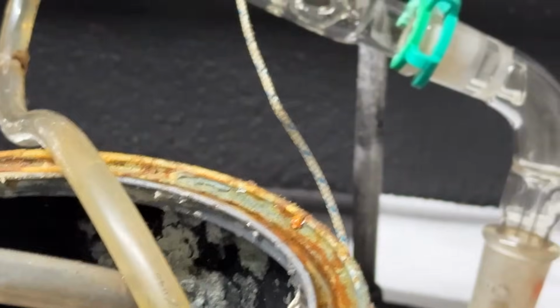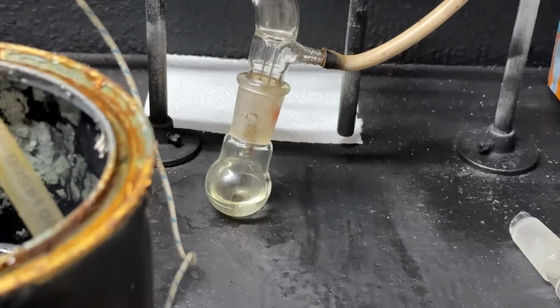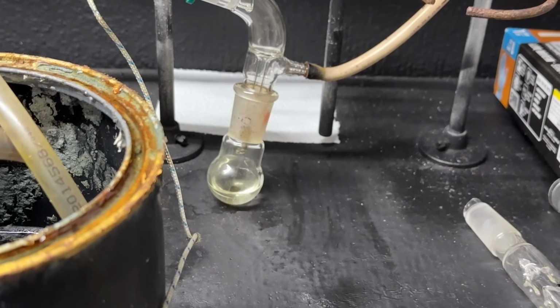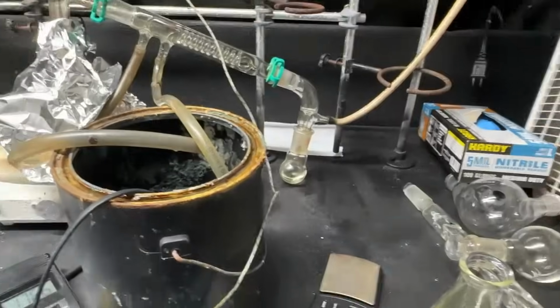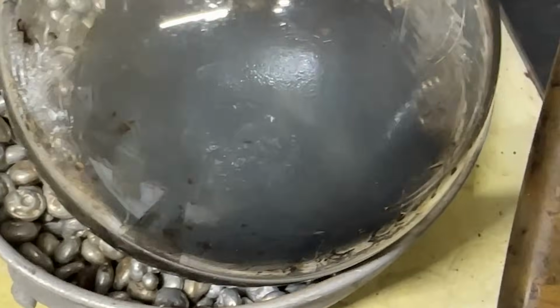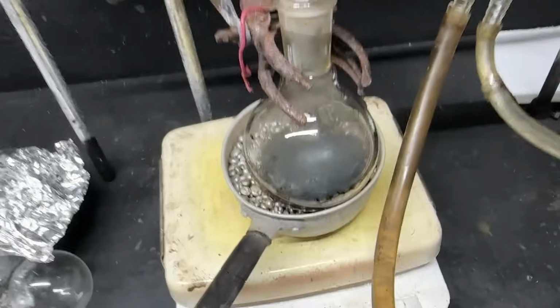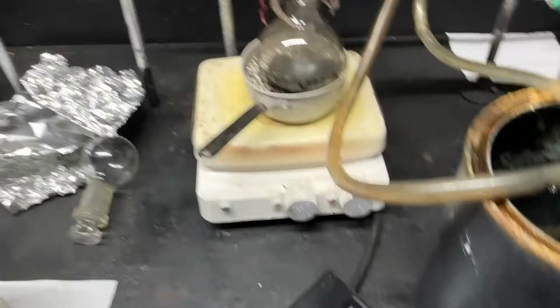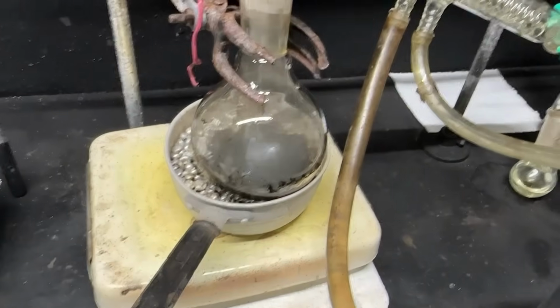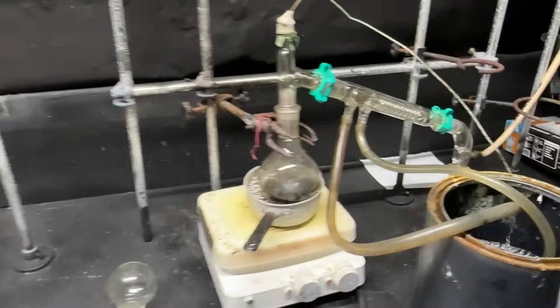Okay, so we're collecting just a little bit of distillate now. Our temperature is starting to drop, so we've pretty much distilled all of our isovaleric acid, and that's about the yield I was expecting. So all is good. I'm going to go ahead and disassemble our distillation. Oh yeah, it's definitely done. There's just a boiling pile of tar at the bottom. Yeah, great. That's going to be a pain in the ass to get out. Probably going to be a piranha acid type deal there.